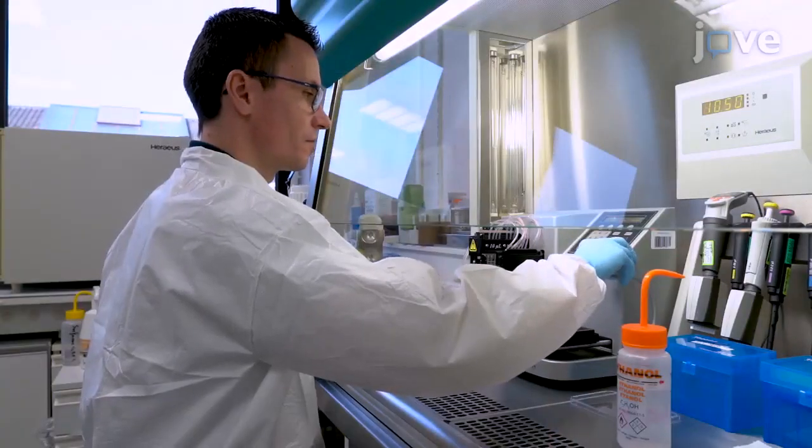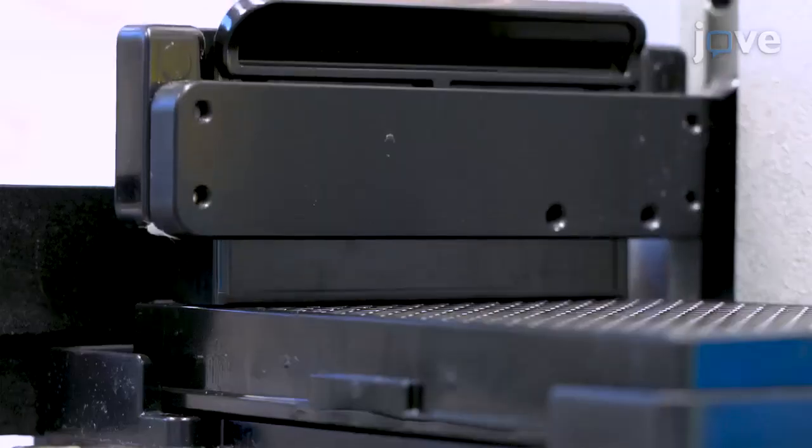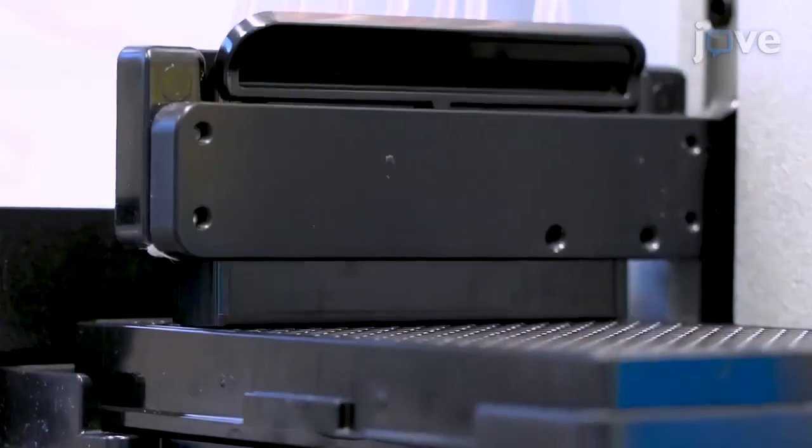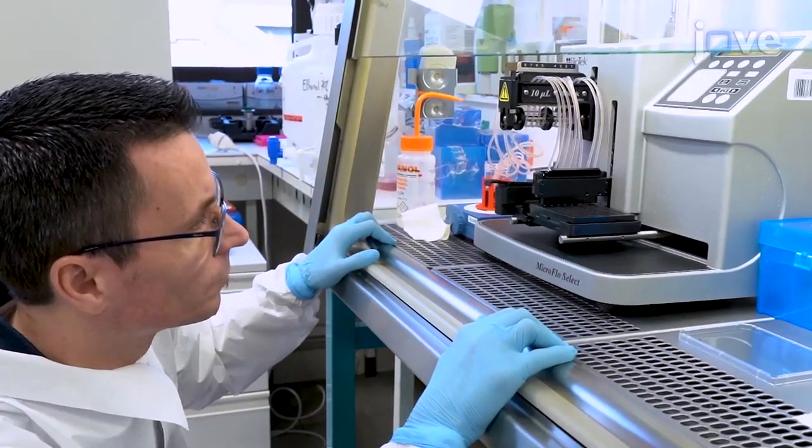Visually control the proper settings of the peristaltic liquid handler head height. Make sure no drops are retained on the dispensing tips while dispensing. Also verify that the head is high enough to allow displacement of the head after dispensing each row.